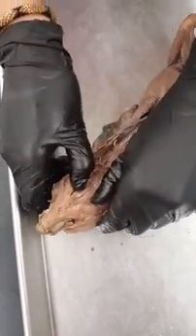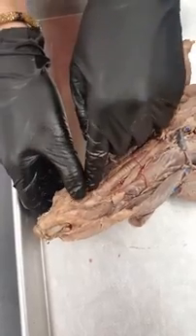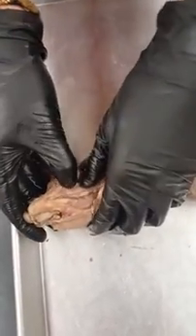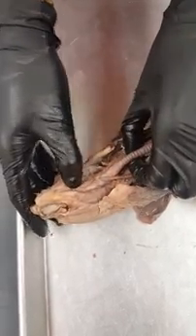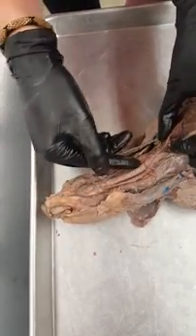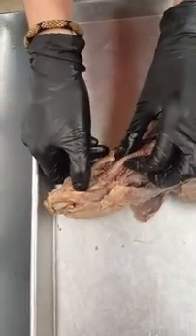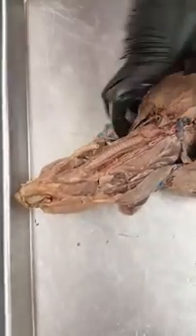In here there are two tubes. One's the larynx which leads to the trachea, and one's the pharynx which leads to the esophagus. The opening of the larynx is called the glottis. The glottis is covered by a flap called the epiglottis, which shuts whenever you swallow so food doesn't go down to your trachea. Instead, the food is pushed through the pharynx, then through the esophagus, which leads down into your stomach.